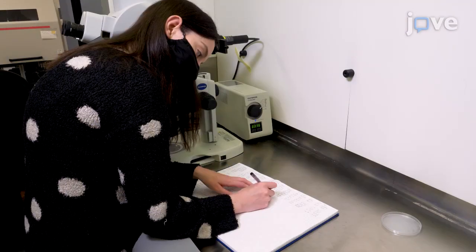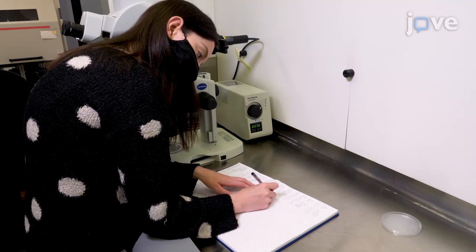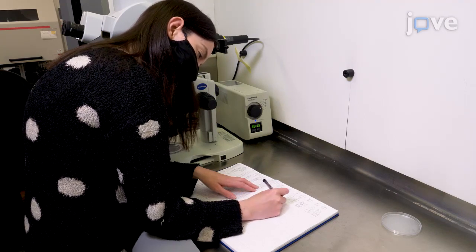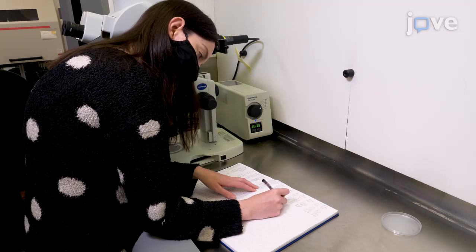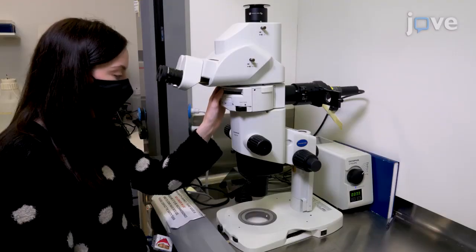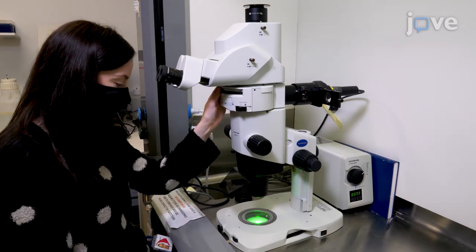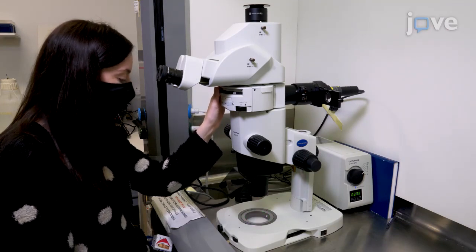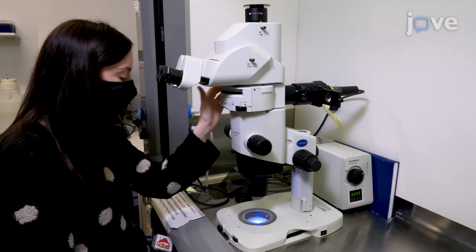Consider the color, spatiotemporal patterns of expression, and ratio of different phenotypes that are expected when screening for a fluorescent marker. Select the required filter on the fluorescent stereoscope and check that there is a colored beam of light visible that is directed at the center of the stage plate.